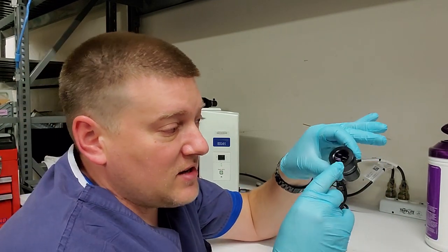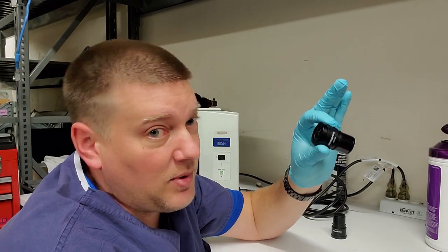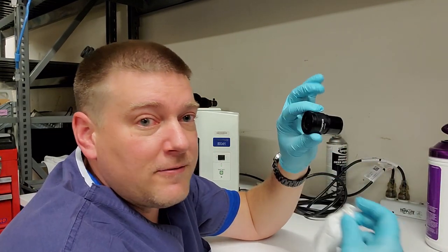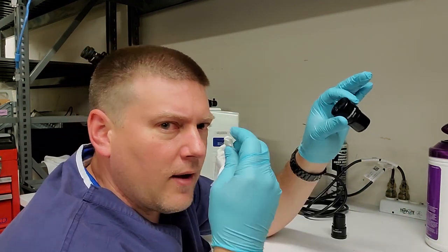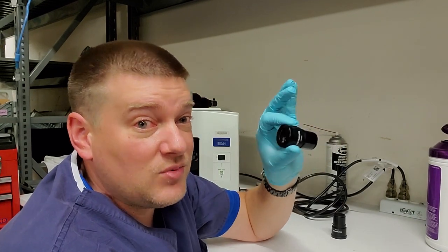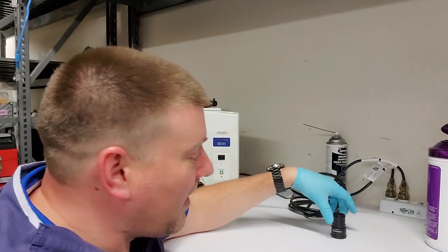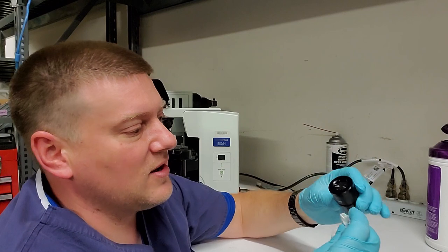Now, like I said, there's a coating on the glass here. So if you use standard things like rubbing alcohol, you could damage, you probably will damage the coating. And Zeiss wipes are soft, they don't leave lint. They've got an alcohol slash ammonia type of substance on there. It evaporates rather quickly. So my ocular, I put it back in. Do not put it back down on the table. It's clean. Put it back where it needs to go.